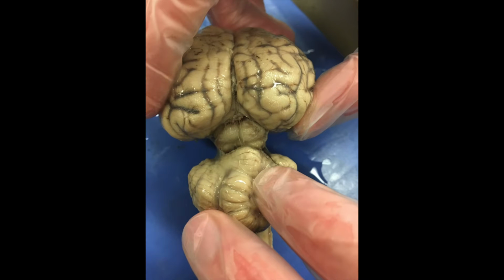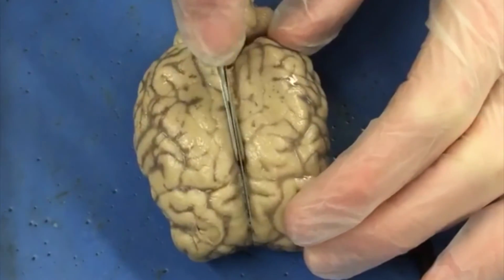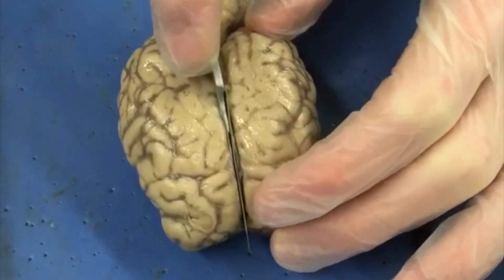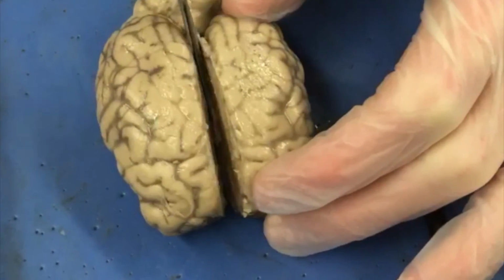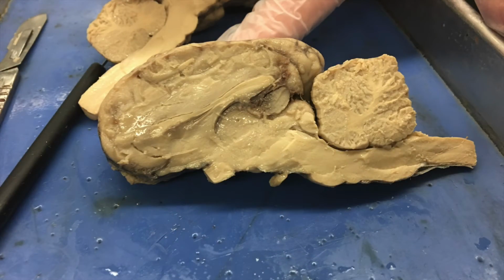As we bent the cerebellum back away from the cerebrum, the superior colliculi and the inferior colliculi became visible. The superior colliculi are the two large bumps, and the inferior colliculi are the smaller ones directly below. These are both parts of the midbrain. The first incision we made into the brain was down the longitudinal fissure, separating the left and right hemispheres from each other. This picture shows the inside of the brain after we made this separation.